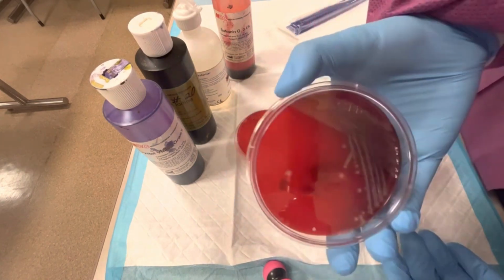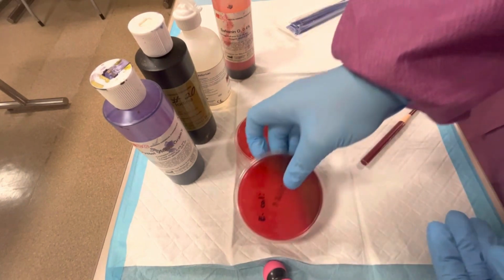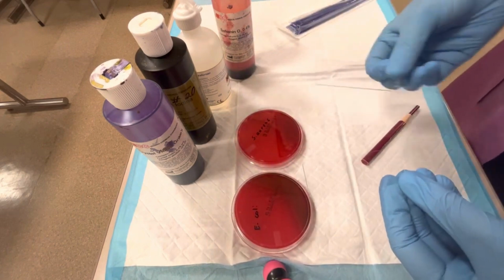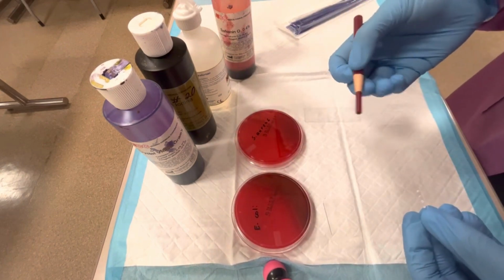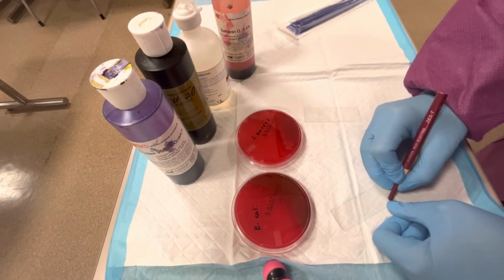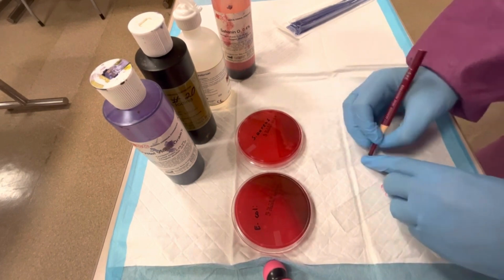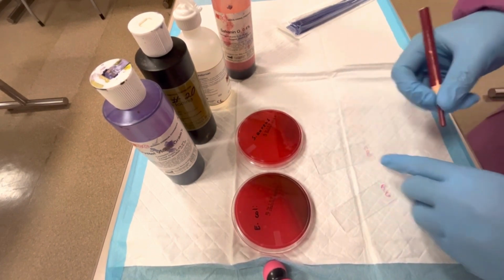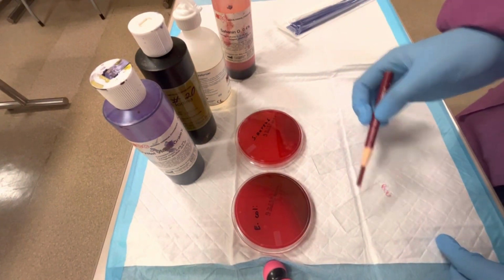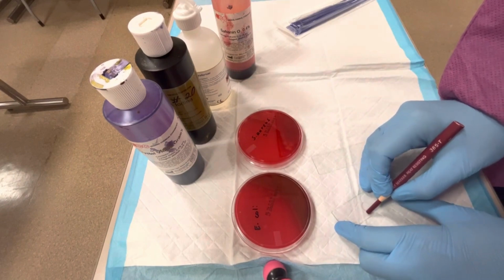And then I have E. coli here, and this should give us a gram-negative result. Now I also have two sterile slides here, and I'm going to take a wax pencil to label the slide. So I'm going to put negative here, and positive here. And then I'm going to draw a circle about 1 centimeter in diameter in the middle of these slides, and that's where I'm going to put my bacteria.